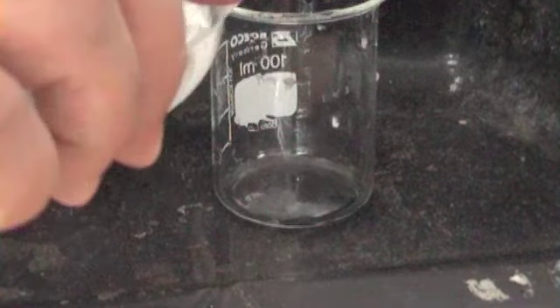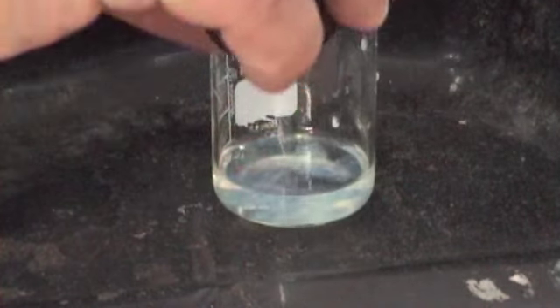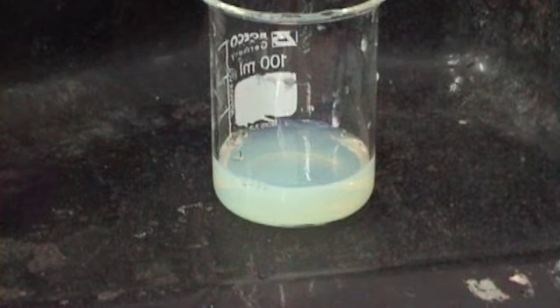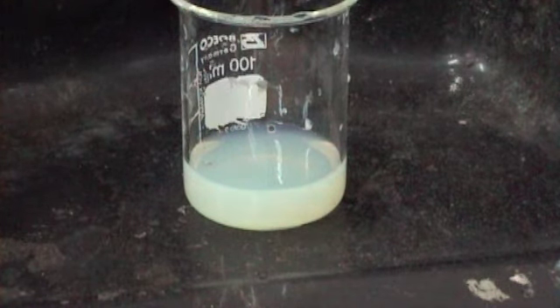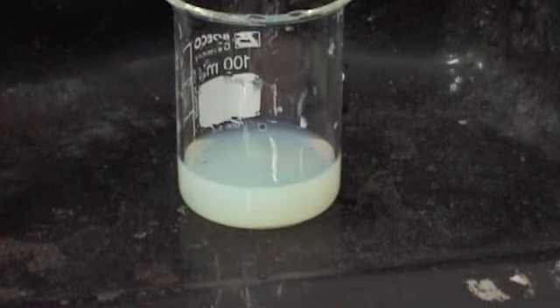Okay, what do we put next? Silver nitrate. Okay, and here's my silver nitrate. And you can see the colour of the precipitate. You can see it better live than you can on the screen. Okay, it's not as yellow on the screen, but it's certainly yellow compared with the white ones we had up there before. Just to give you an idea of a colour match, there's a white one. Okay, you can see the difference in colour.